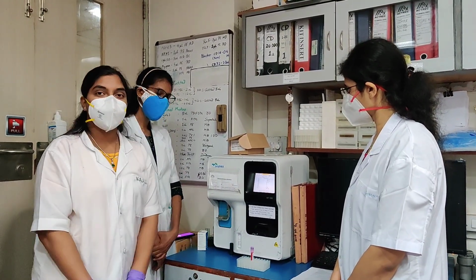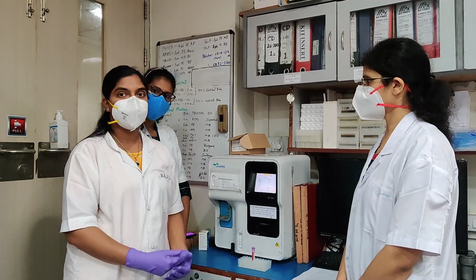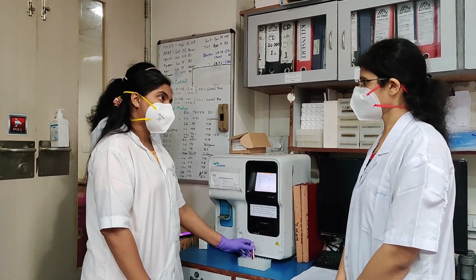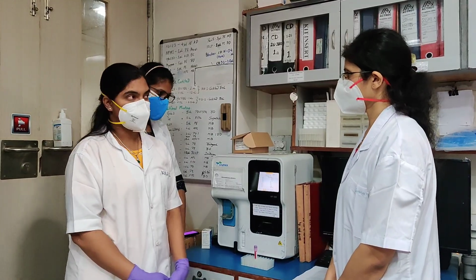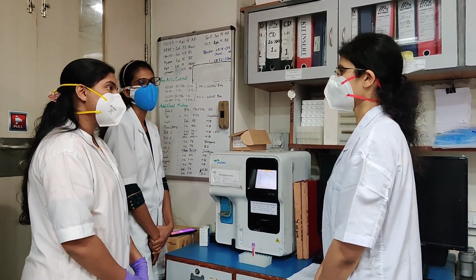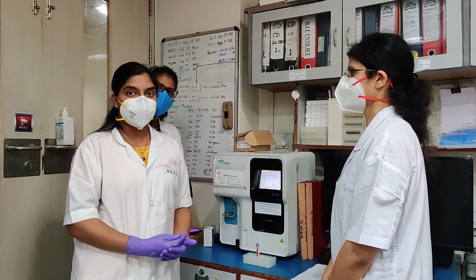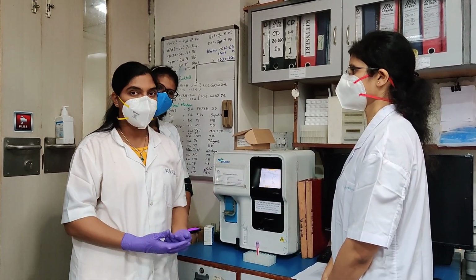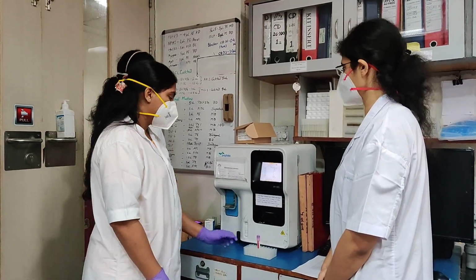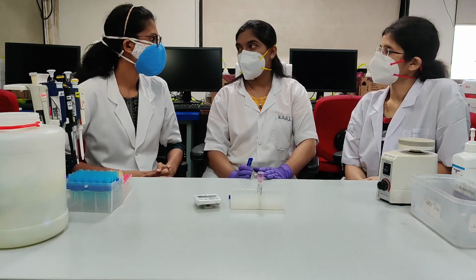As per the manufacturer's kit, if the count is more than 40,000 per microliter, the sample needs to be diluted. For dilution, we take 1 part of sample and 9 parts of PBS. But why is it important to dilute the sample if the count is more than 40,000? As per the kit's limitation, if the count is more than 40,000, it will affect the staining and bead concentration, and the results may not be reliable. We are now done with the cell count.